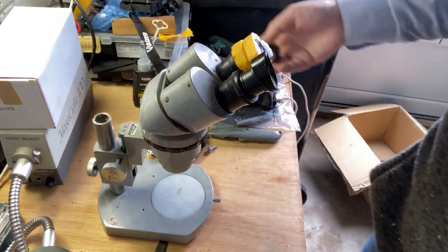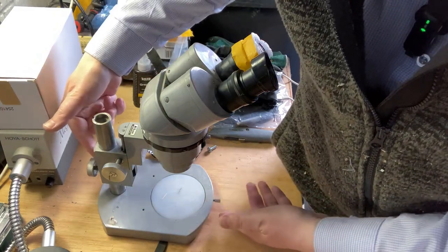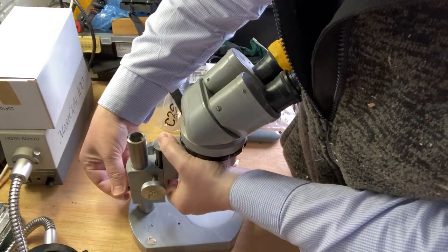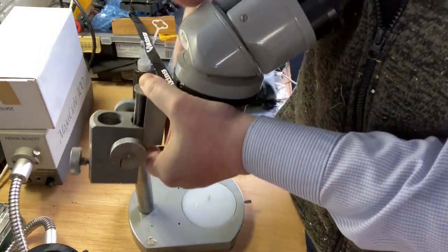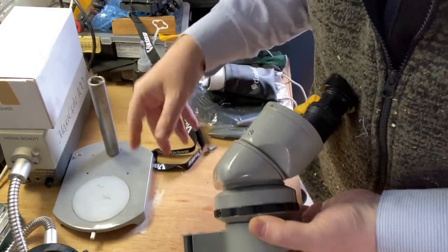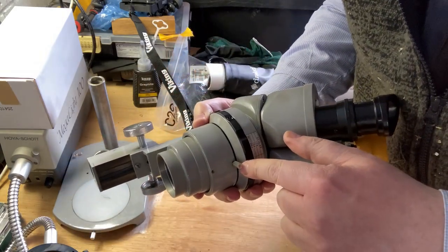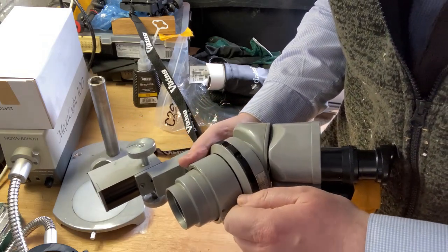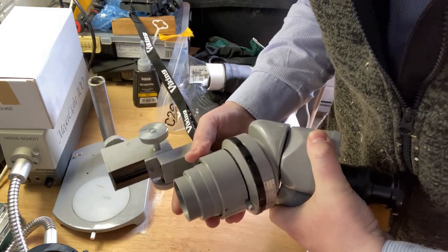This is just a spare eyepiece so I didn't lose it, the eye cup thing. And so I'm just going to take it off the base here. It's just held in with the screw there, so I'm just going to unhook and lift it fully up, and that is now off the base. I'll show you about the base in a minute. And then the next bit is, you can see there is a little screw on here, which is a collar for here. So I'm just going to unhook that as well, and then I can take off the optic.